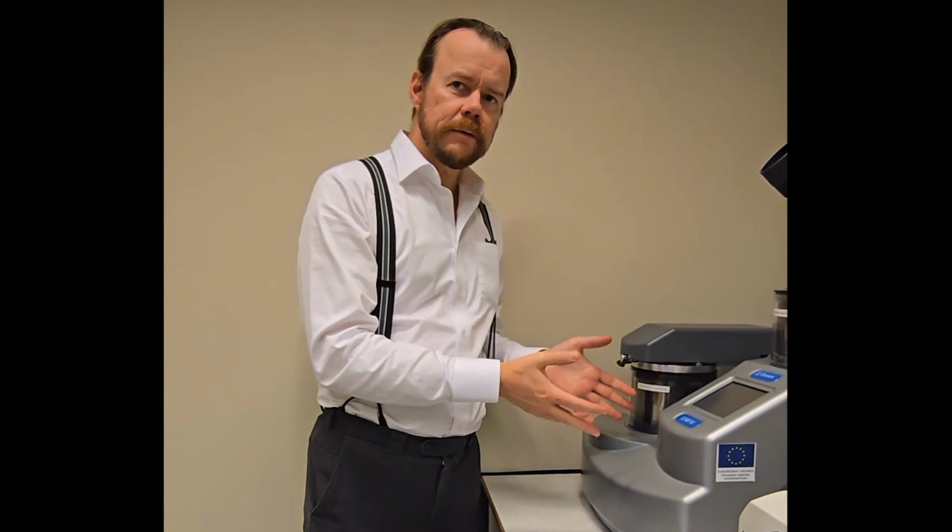So this is a sputter. There are two ways to coat a sample for electron microscopy. One is evaporation. That means you make a metal or a carbon into a vapor, basically, that sort of coats everything. The drawback with that is that it's not so well defined. You get some kind of coating, but you cannot decide the thickness and so on. It also creates poor quality coatings.